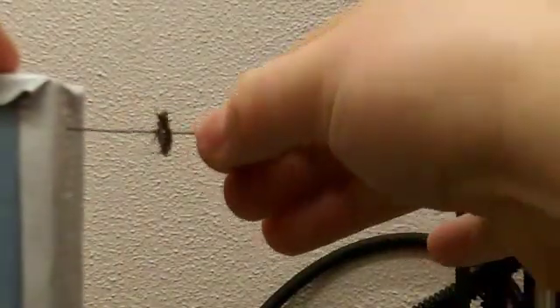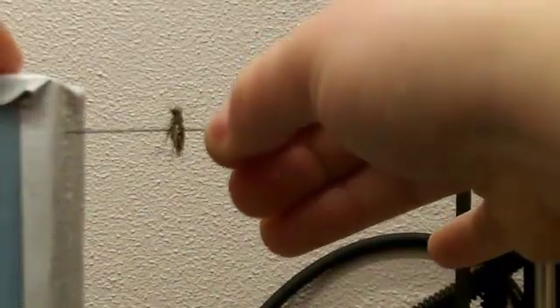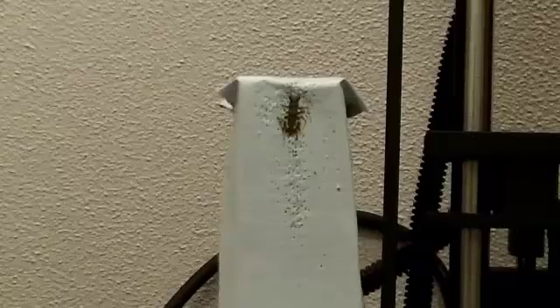For the head shot, you take the specimen and you stick the pin, once again, into the stand so that the head is facing up. Generally, this is how your specimen will end up looking.